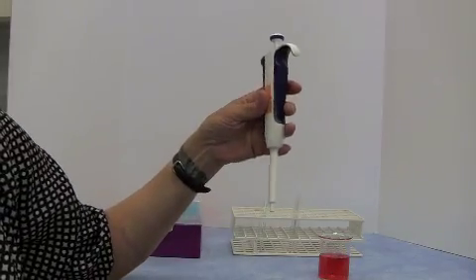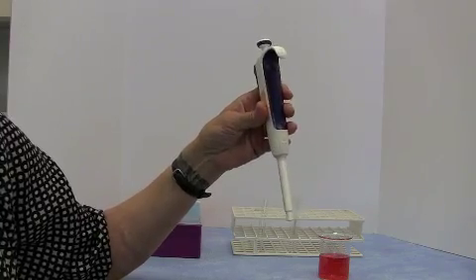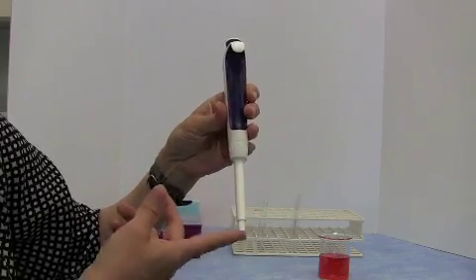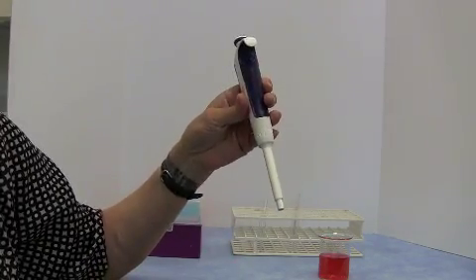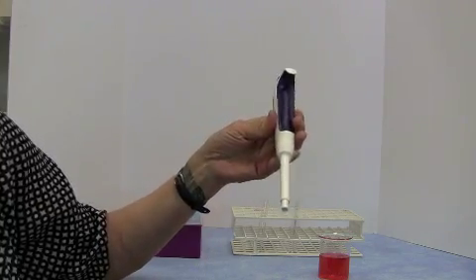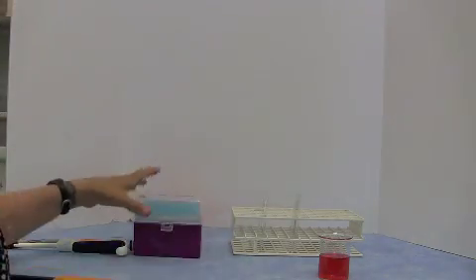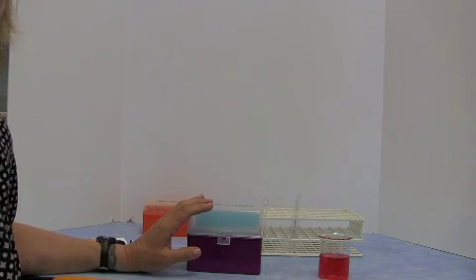We dispense liquid with these micropipettes using micropipette tips, because we don't want to just stick this into our liquid, because that would mean we'd be cross-contaminating the whole time. So you'd be mixing up your chemicals, you'd be contaminating things with bacteria, you'd be doing whatever. So we use these micropipette tips, and we use a clean one for each new solution that we're going to pipette.